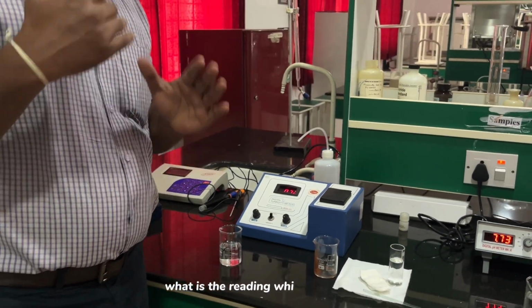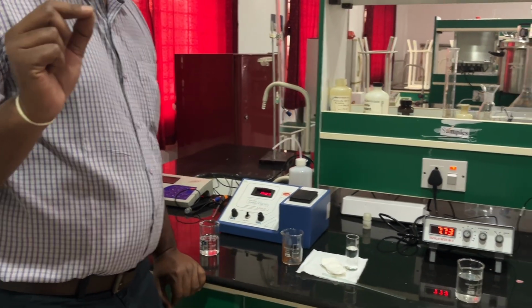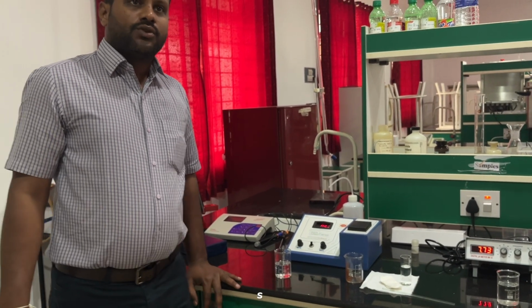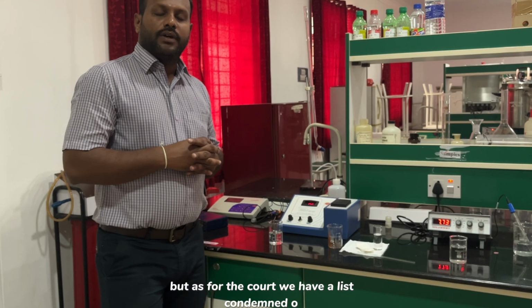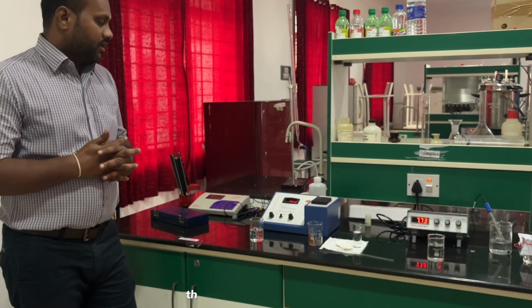Note the reading of turbidity in NTU. The turbidity in drinking water should be less than 5 NTU, that is nephelometric turbidity unit. Most probably there should not be any turbidity in drinking water, but as per the code it should be less than 5 NTU. So this is about the turbidity.